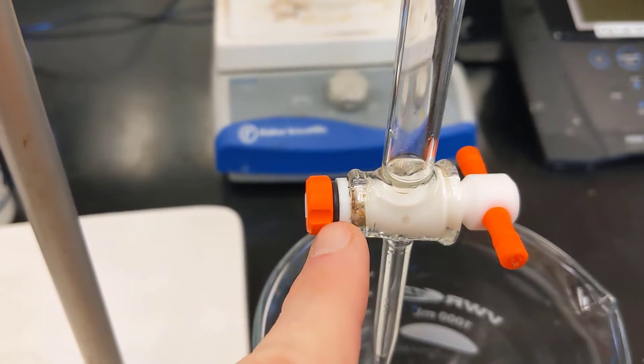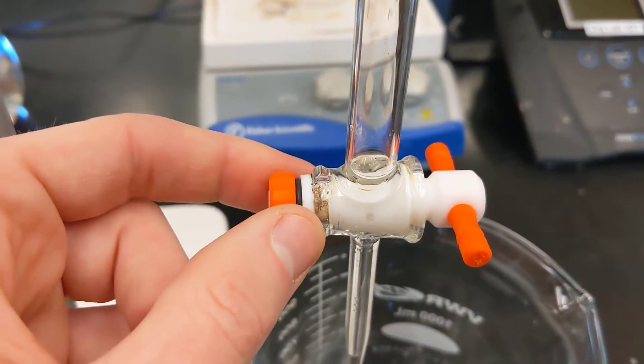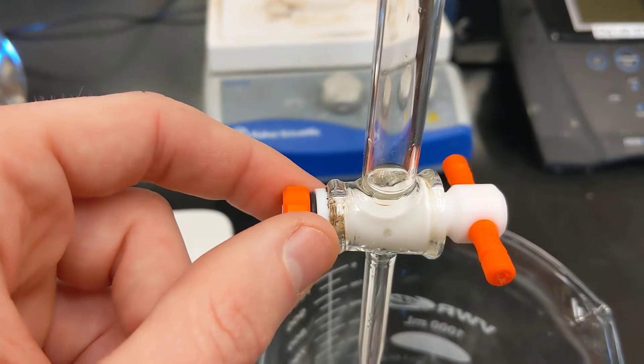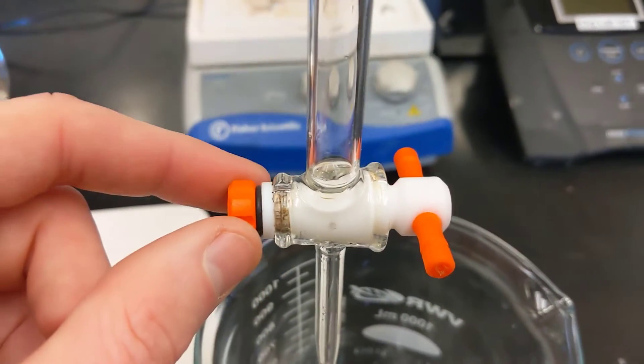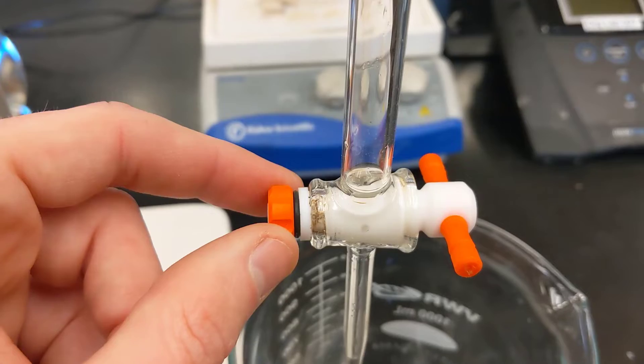If the O-ring and the washer are switched, or if the O-ring is not present, then you may get leaking, which will affect your volume measurement in your titration.